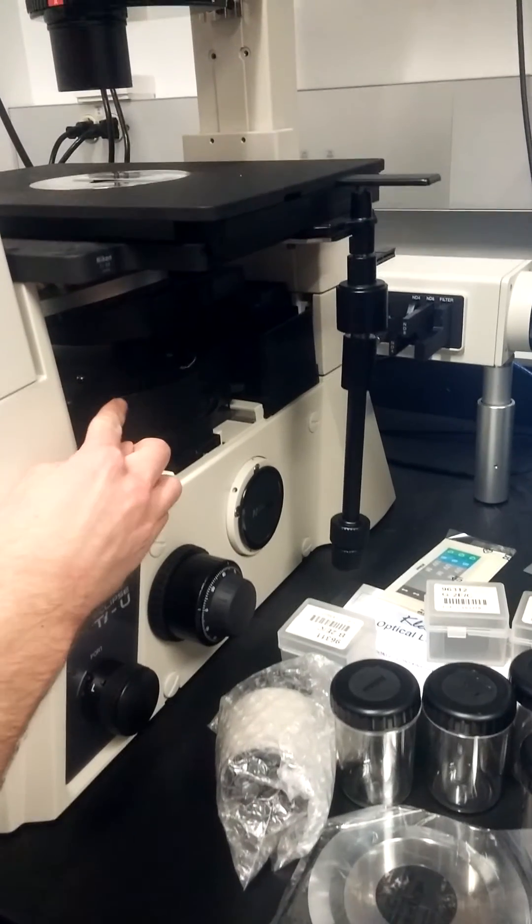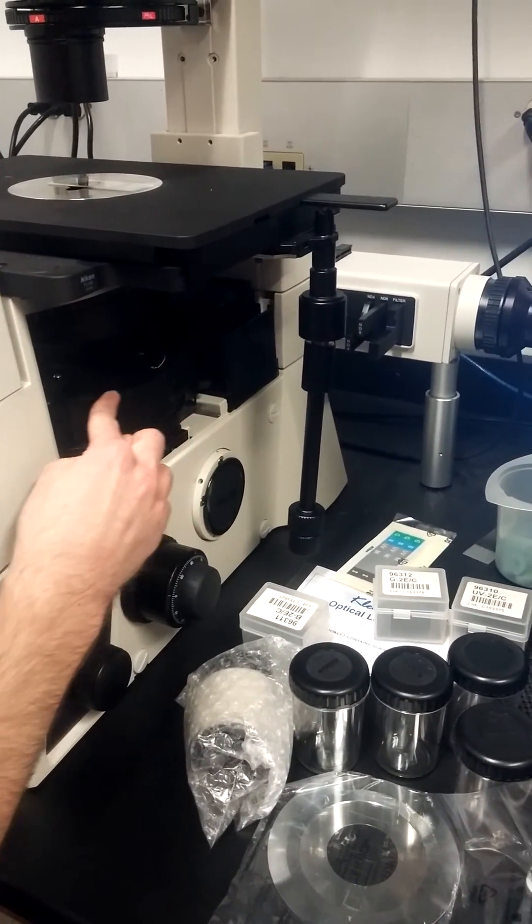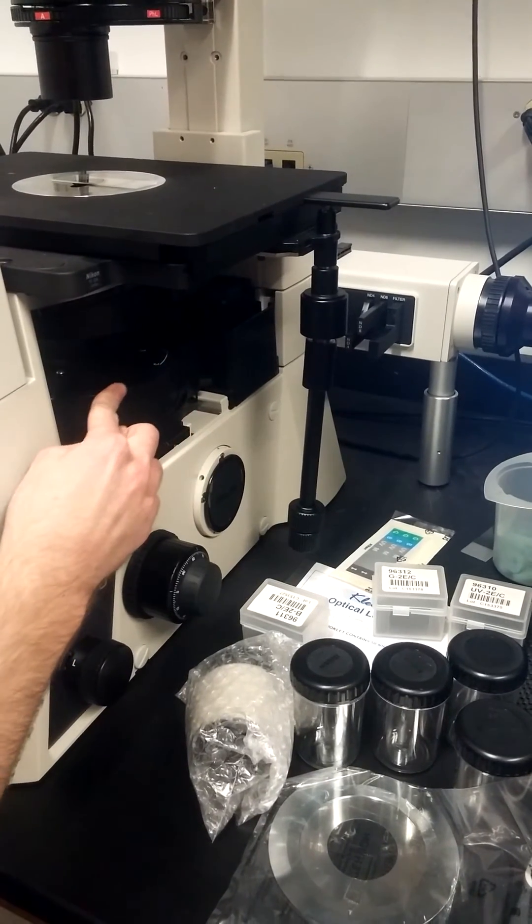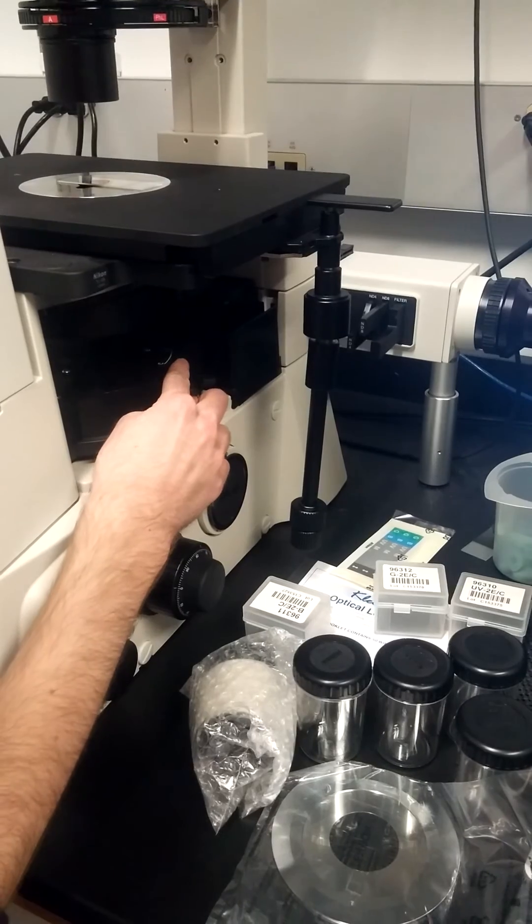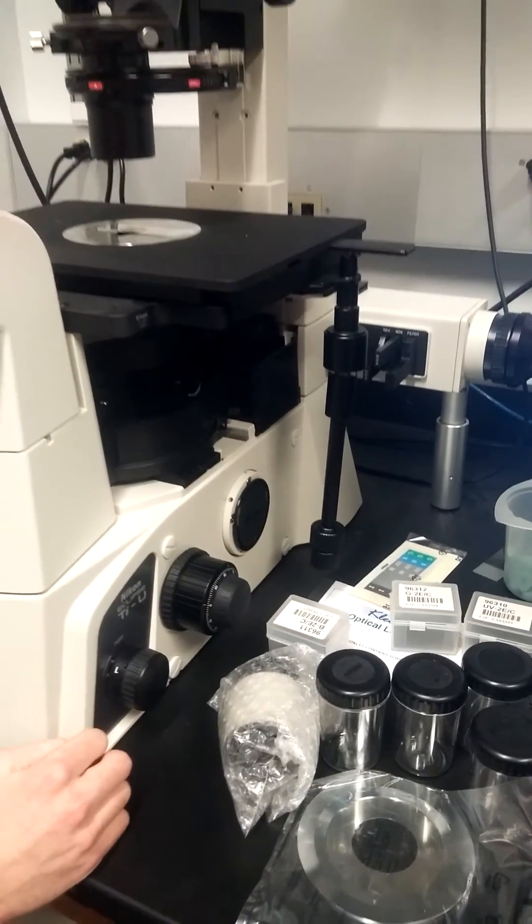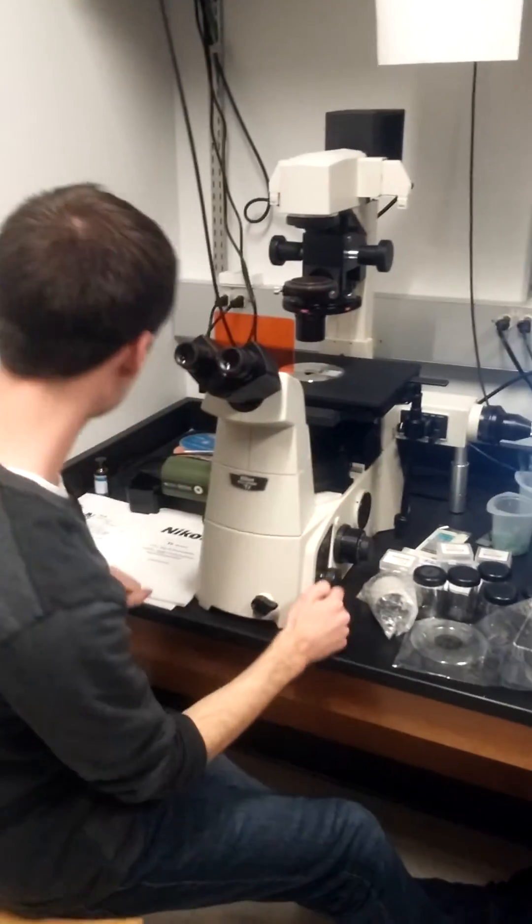there's a kind of hard-to-find wheel that we can switch from one filter block to another. And once we're sure which filter block we're using, we'll let you know which number that's associated with.